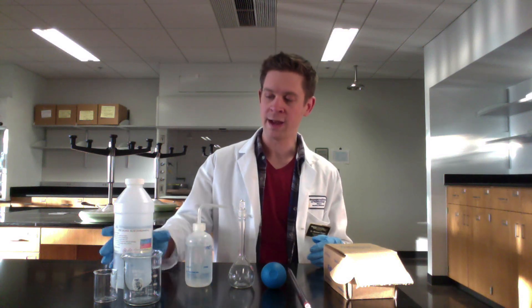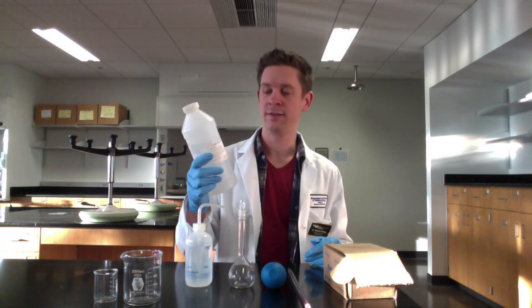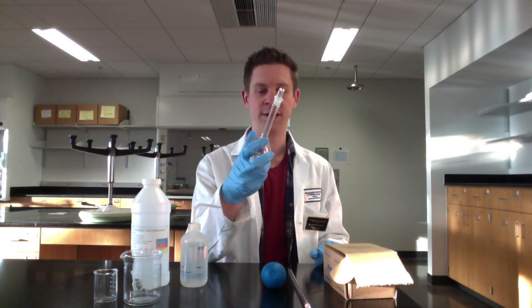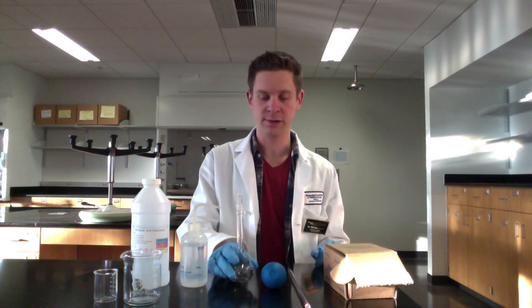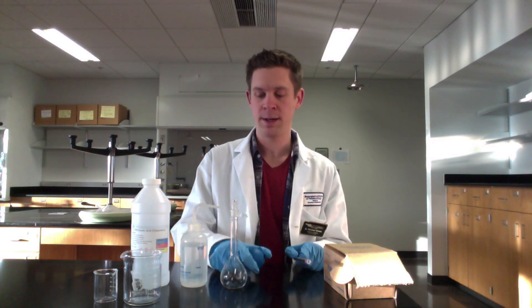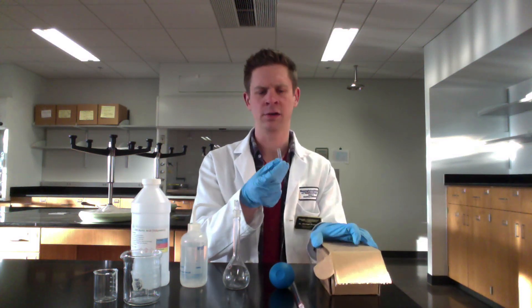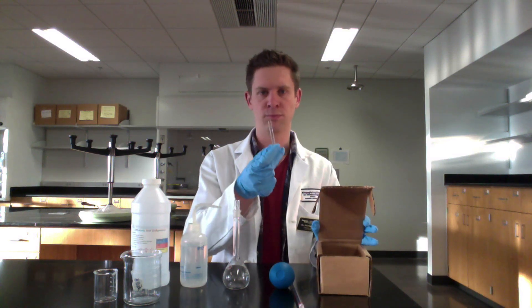Here is everything you'll need for a dilution. We have a reagent bottle containing the stock solution — in this case, 0.1 mole per liter acetic acid. I have two beakers; two are going to be necessary, as you'll see in a moment. There's a wash bottle containing deionized water, a volumetric flask for measuring volume with one precise mark at 100 milliliters, a serological pipette and pipette ball to measure out the stock, and Pasteur pipettes — small glass pipettes without markings — which we'll use for dropwise addition.